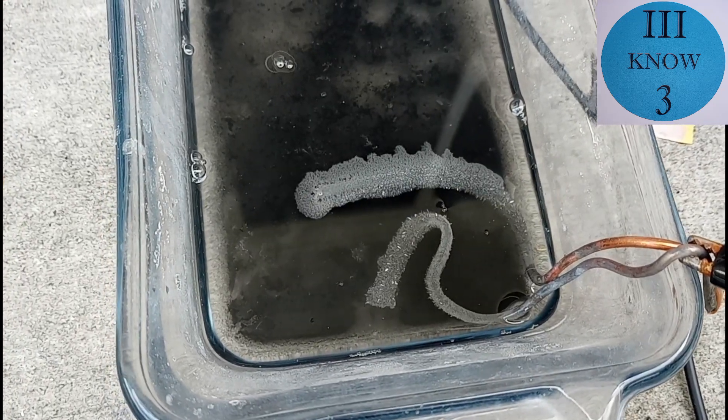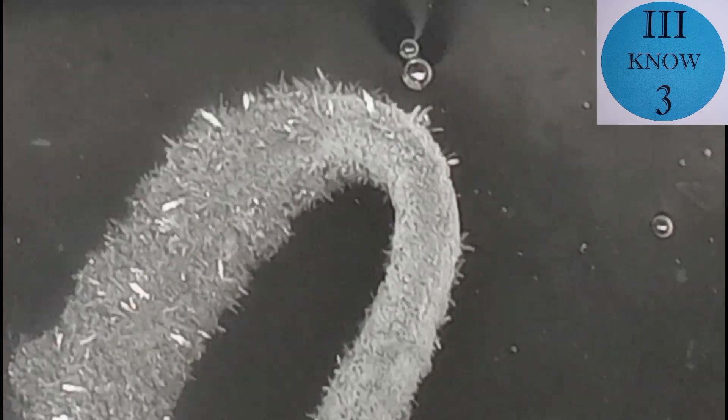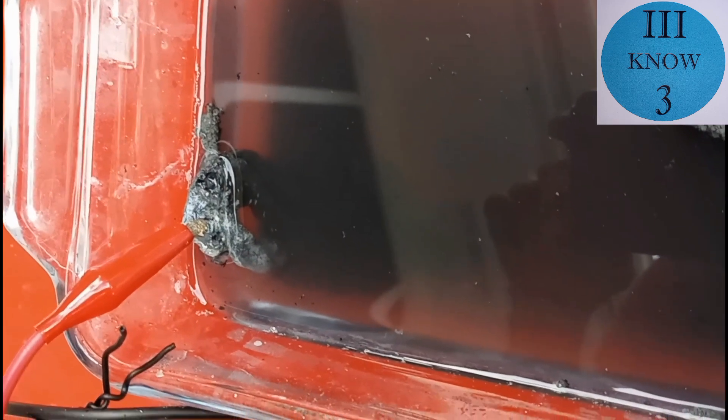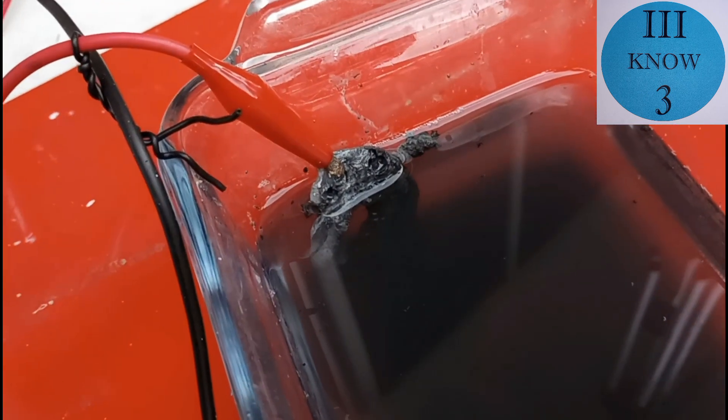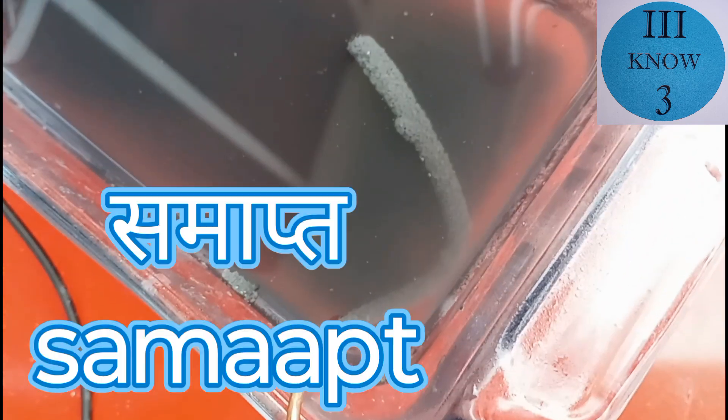Okay, so to me this feels like winning a battle. It's a small victory and it's not winning the war, but it's definitely a victory. So you can see here that amongst the mossy tin that we've been growing, it appears that we are growing what look like good pure tin crystals. So this is a while later and really not much had changed. It's still growing sporadic pure tin crystals, but it's also still growing the mossy tin. So I think until I get things more pure, that's going to continue to happen. So I think I'll wrap this one up here and do a follow up soon. The end.